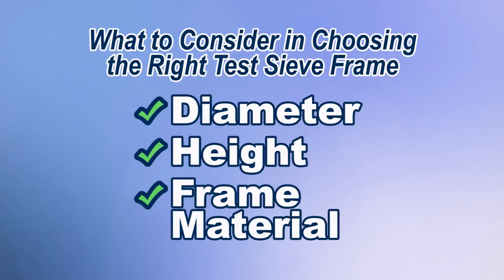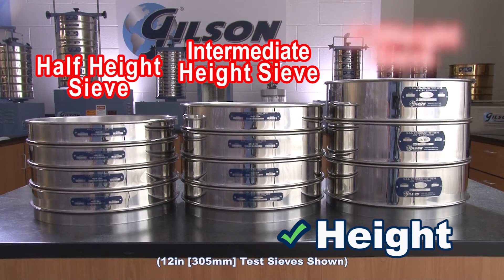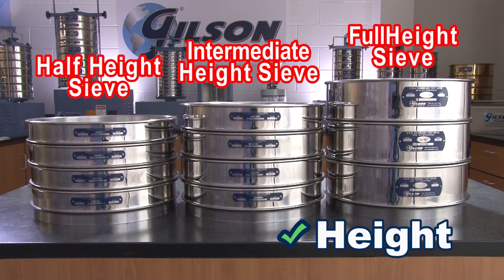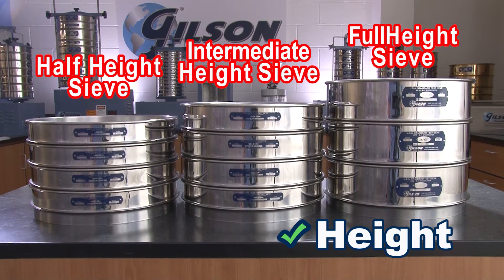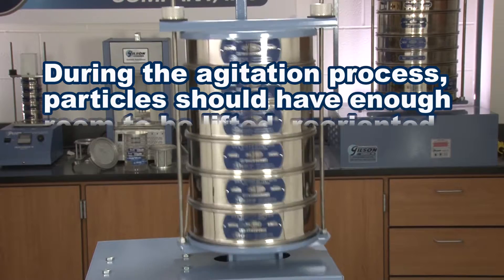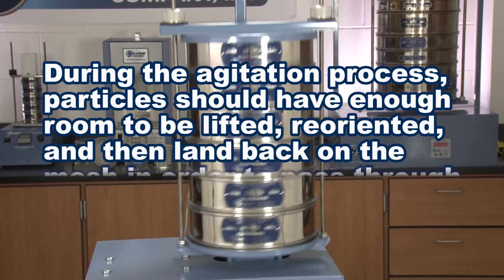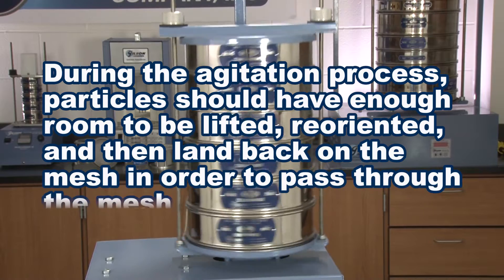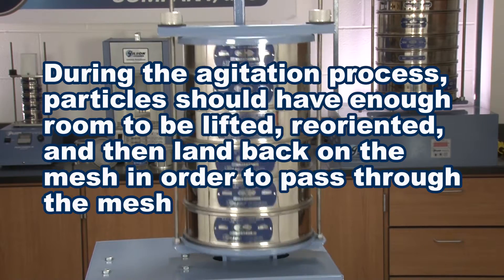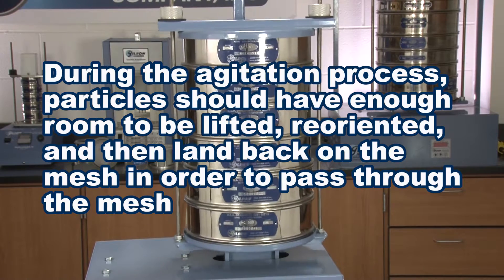The frame height of a test sieve allows for maximum testing efficiency when separating multiple fractions on a sieve shaker. During the agitation process, each particle should have enough room to be lifted off the mesh surface, reoriented, and then land back on the mesh in a different position in order to have the opportunity to pass through the mesh.